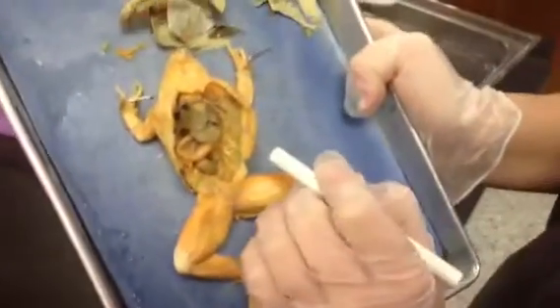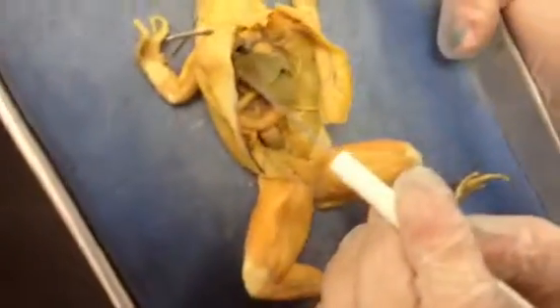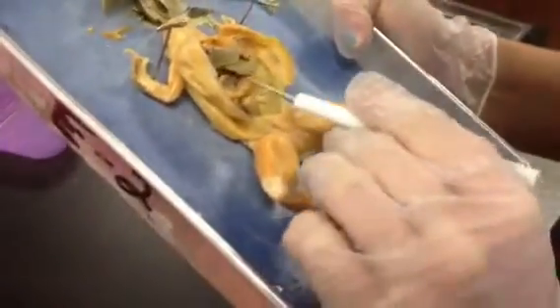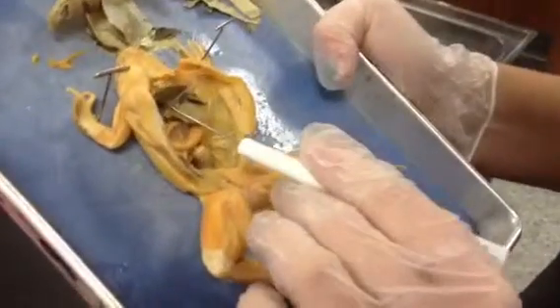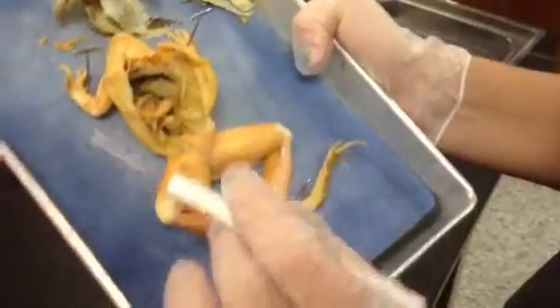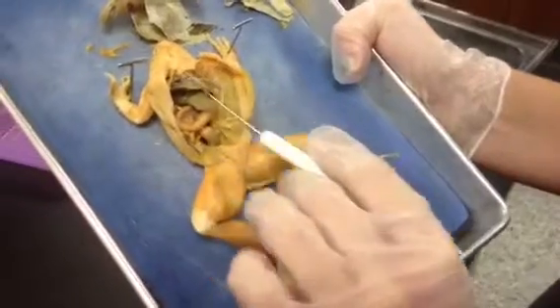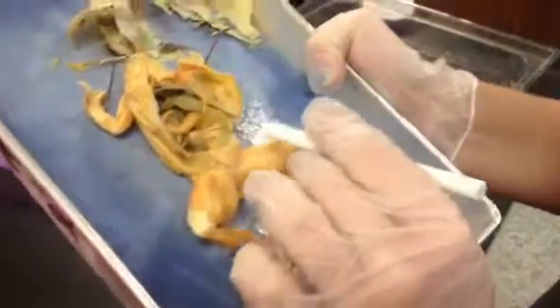Right here you see the heart, and you see the pericardial sac. Under here you see the lung. Here is the esophagus and the trachea, and the fat bodies.